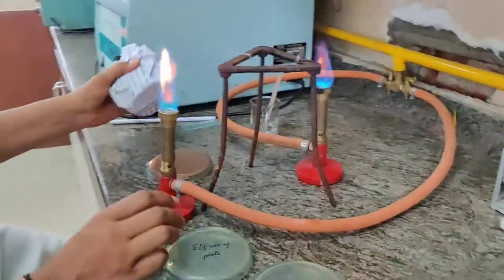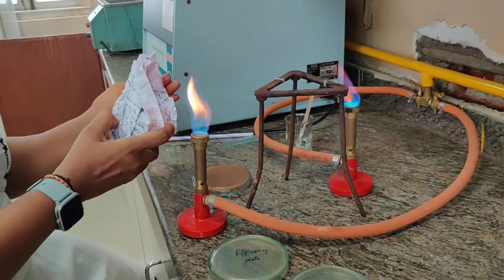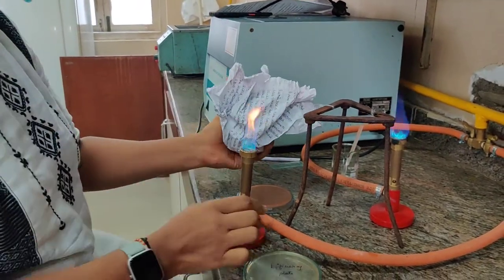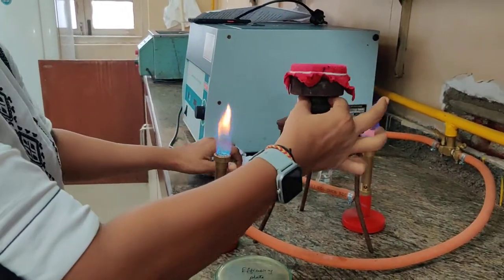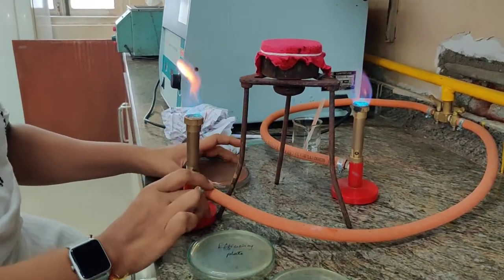To begin with, we are going to take the replica block — a sterile replica block. We are going to open it in between the burners and keep it upright like this, supporting it onto a tripod stand.